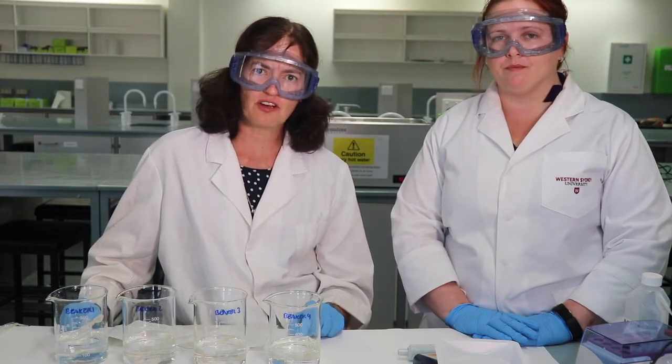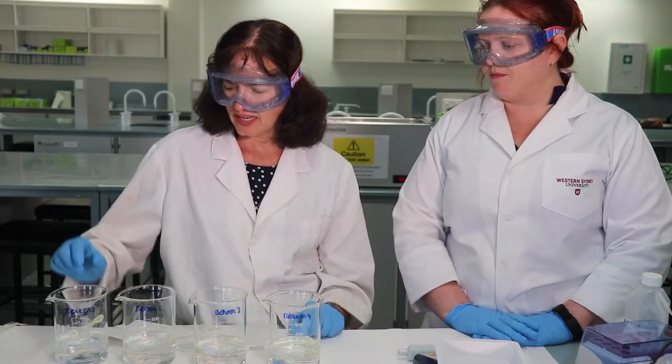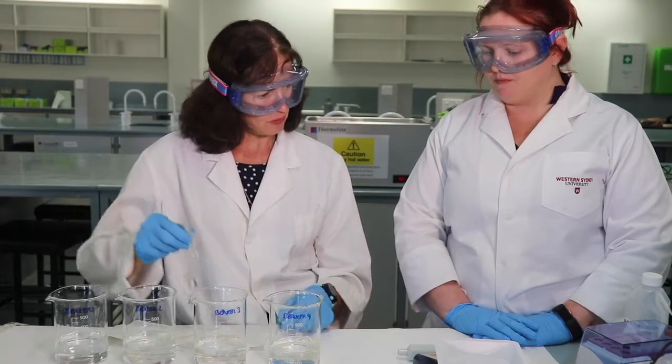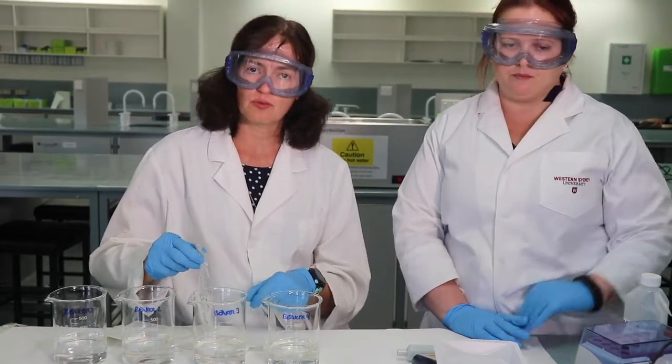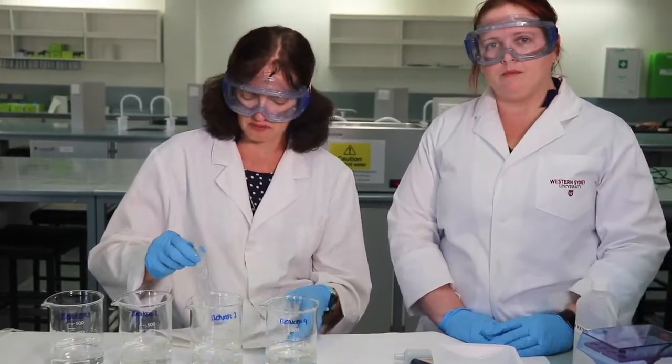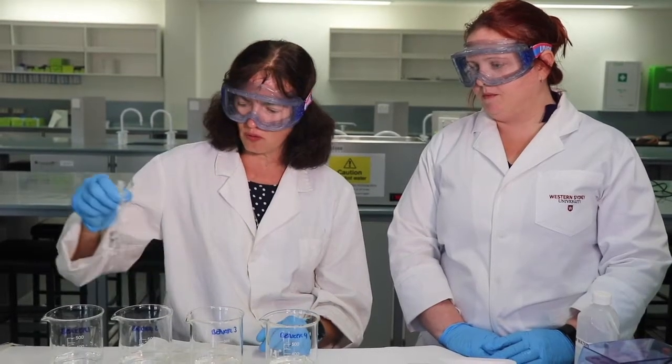We would then stop the timer on our stopwatch and again remove each of the bags from the beaker. We can wash them over the sink with deionized water from the squeezy bottle and again pat them dry and again weigh the bags. And we'll do that for all 4 bags every 20 minutes. So at time 0 at the beginning of the experiment, at time 20 minutes, 40 minutes, 60 minutes, and then 80 minutes.